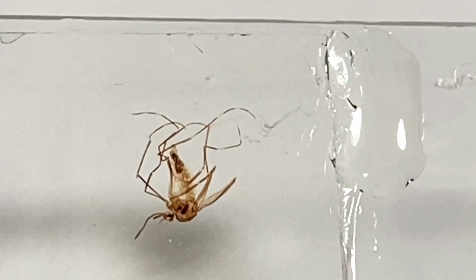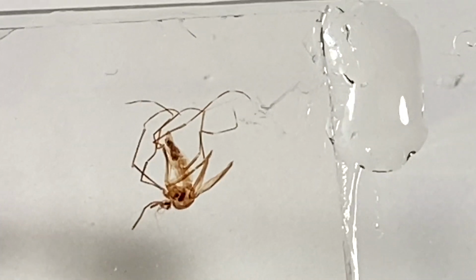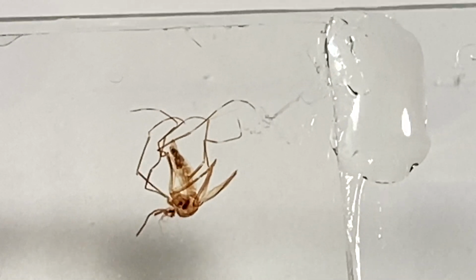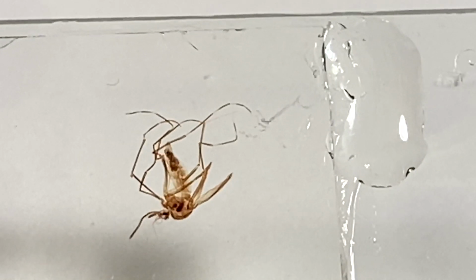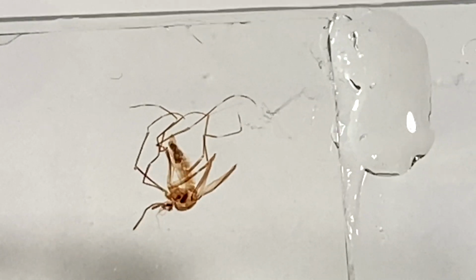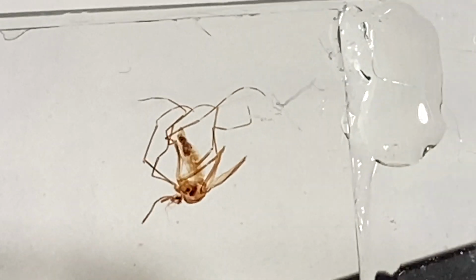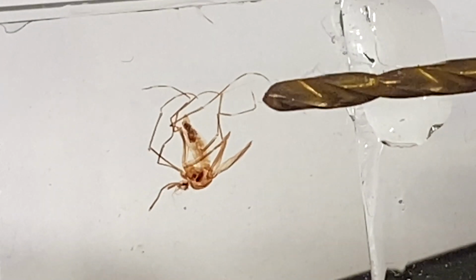Now, what happens with the heat is that if it's placed directly underneath the bubble, the heat is going to cause the gas bubble to expand, and it has to go somewhere, okay? And so it usually will move in the area of the melted resin. So if you take your heating tip, let's say this is the heating tip. Let's get rid of that. I don't like that. Let me use this. Let's say this is my heating tip, okay?